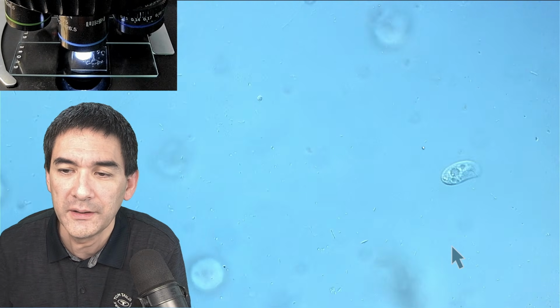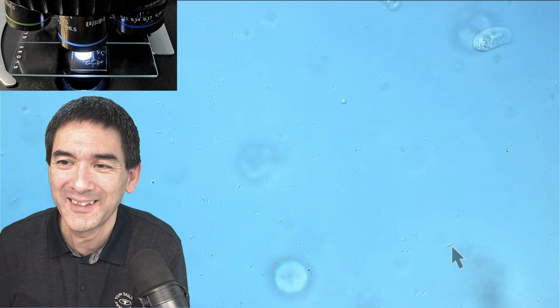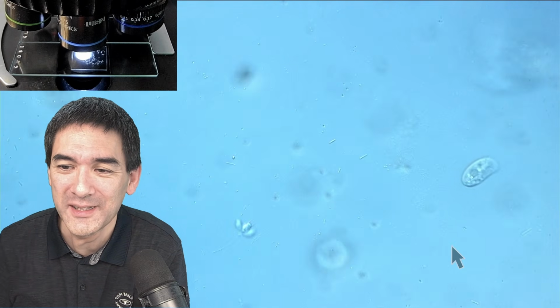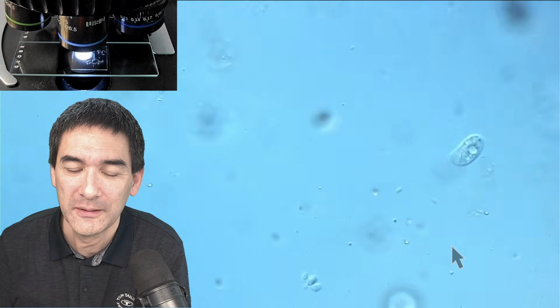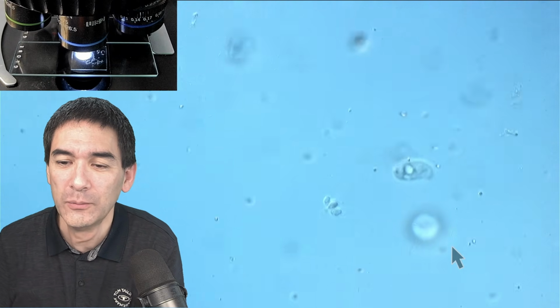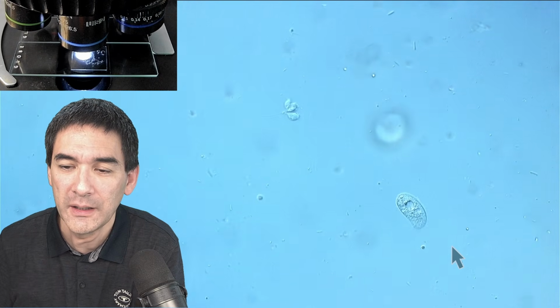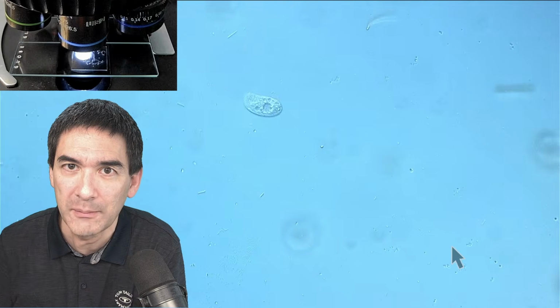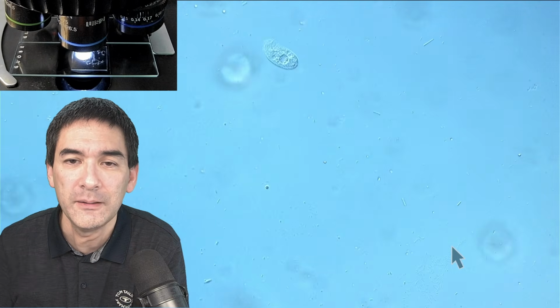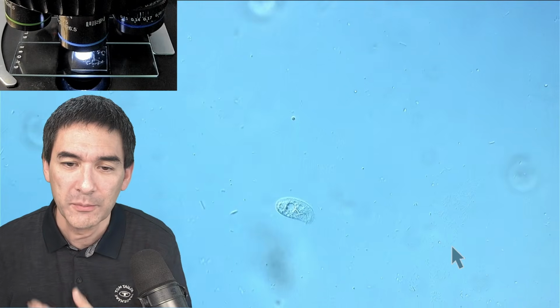I was hoping that it's gonna be frozen a little bit in time, so that you can really see a stationary cell. Unfortunately, that is not the case. Another way of limiting the movement, of course, is by simply using very little water. In this case, the cells become sandwiched between the cover glass and the microscope slide, and this also inhibits the movement. Excuse me, I'm kind of losing my voice a little bit.